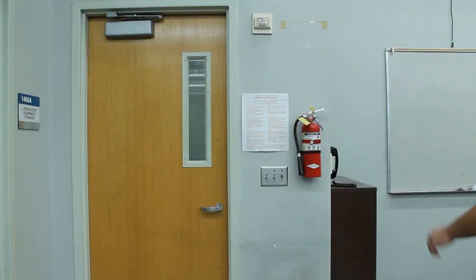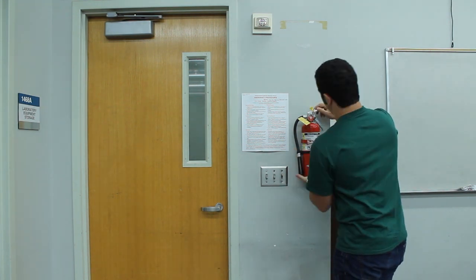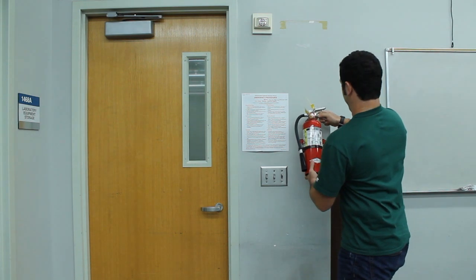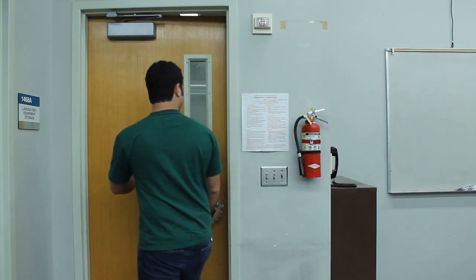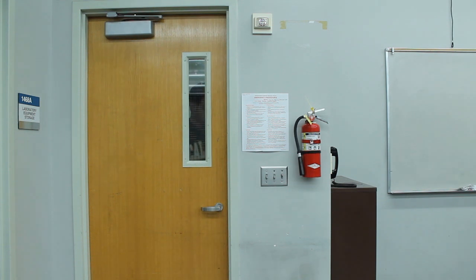If a small fire occurs in the lab and your personal safety is not threatened, inform your instructor and calmly retrieve the fire extinguisher to put it out. If the fire becomes too large or is endangering your personal safety, calmly evacuate the lab, close the door, dial 911, and activate the building's fire alarm.